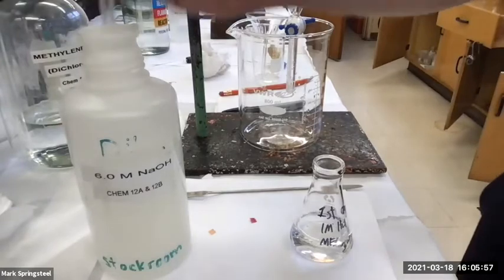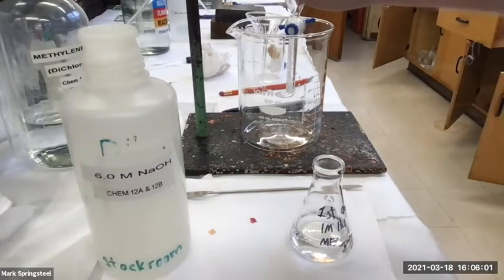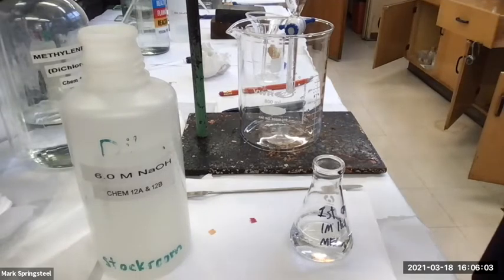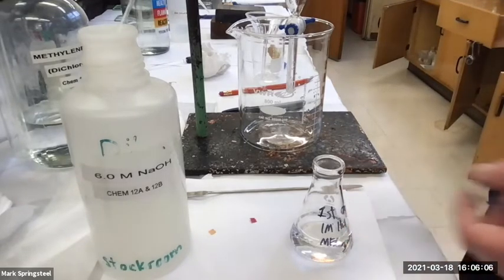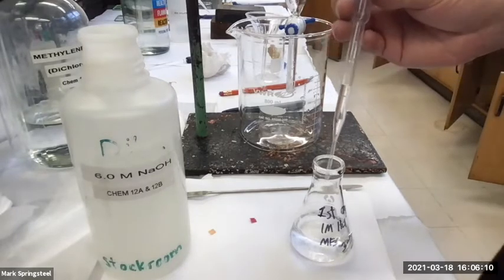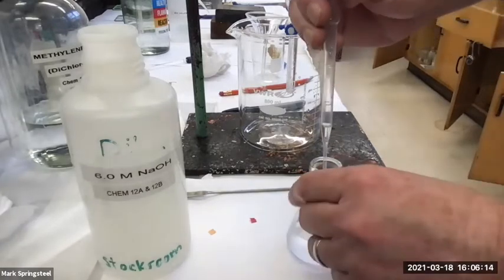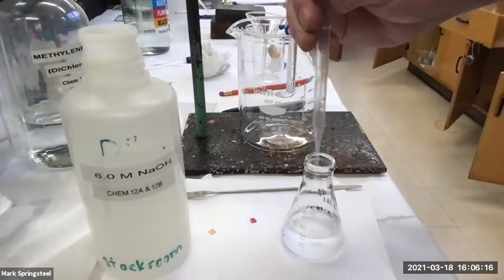Because I'll only have to use a 1/6 of the volume. I won't have to add a lot. Because if I used 1 molar NaOH, I'd have to use that same volume. I'd have to use a lot. So I don't want to do that. Because if I add a lot of water, then there's going to be a little bit of water solubility for these things. All right, so far, does it look like it has amine in it?